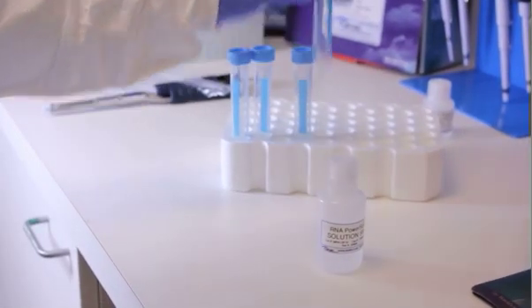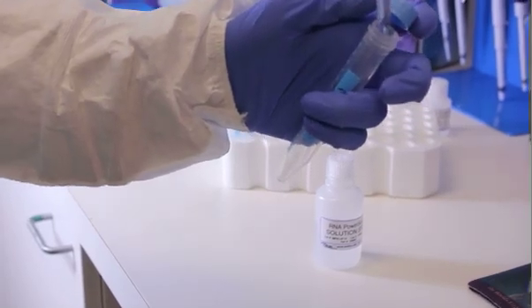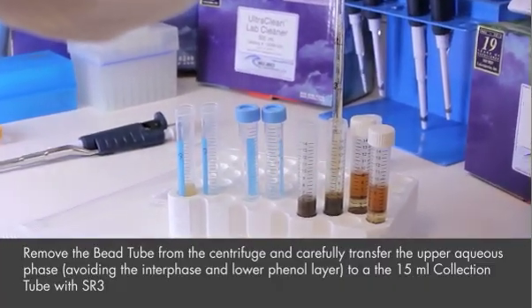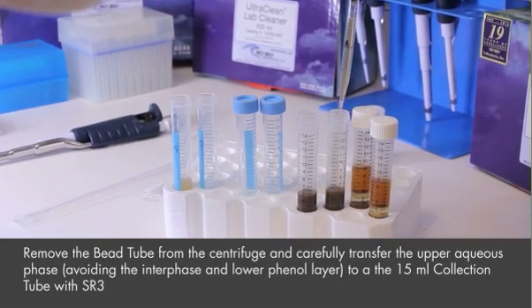Add 1.5 mls of SR3 to a clean 15 ml tube. Carefully transfer the upper aqueous phase to the 15 ml collection tube with SR3.